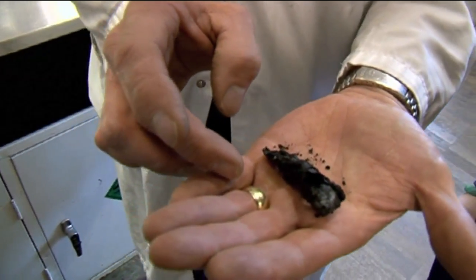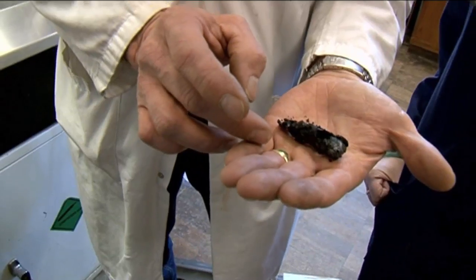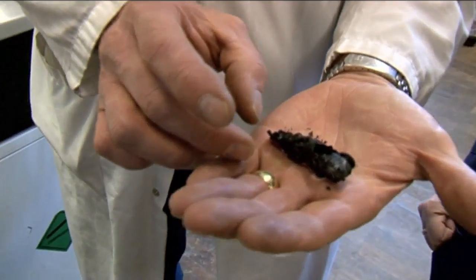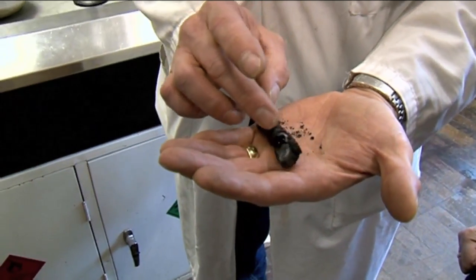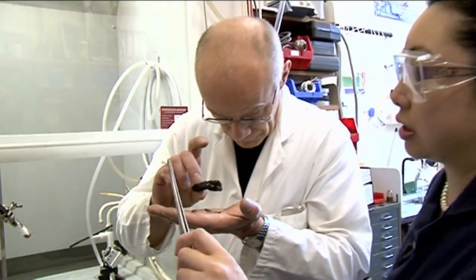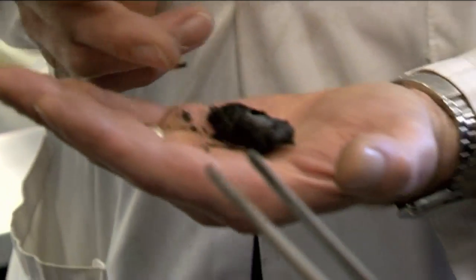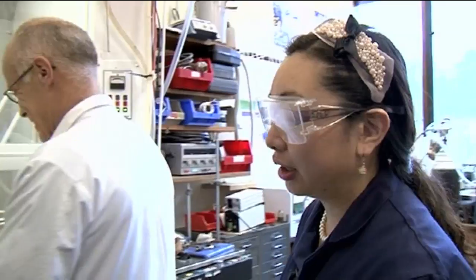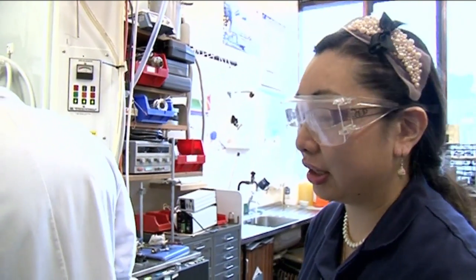It's as if the jelly baby's been eaten from the inside out. We do expect carbon to be produced by the chemical reaction, but this is unexpected. You do expect sometimes the reaction to be so violent that the jelly baby gets ejected from the actual tube. What I've never seen is actually the hollowed out shell of a jelly baby. It's a jelly baby corpse is what it is.